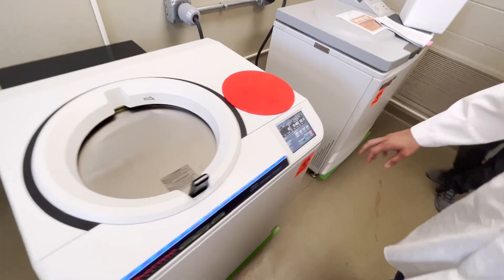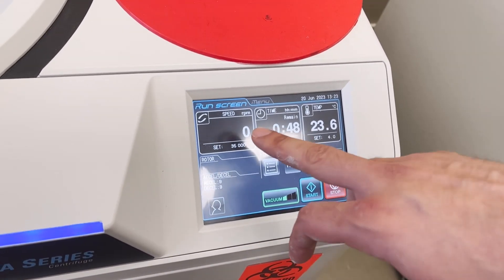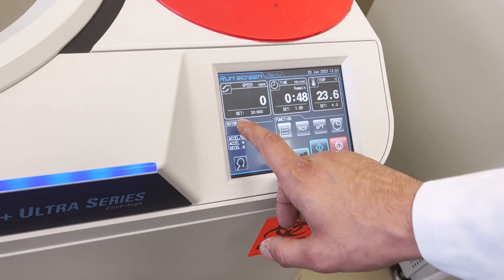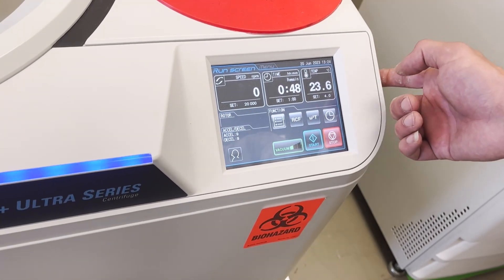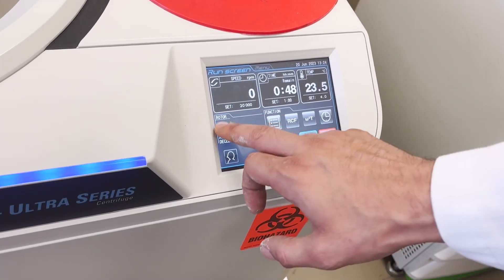Then you can put your vacuum on, or you can enter your settings first and then apply the vacuum — it usually doesn't matter. Before you choose any settings, you need to tell the machine which rotor you have, so you enter the rotor number here.